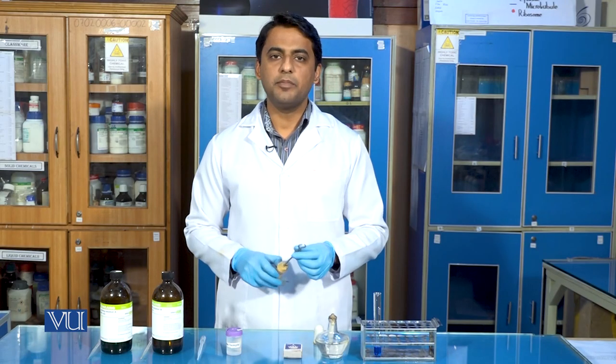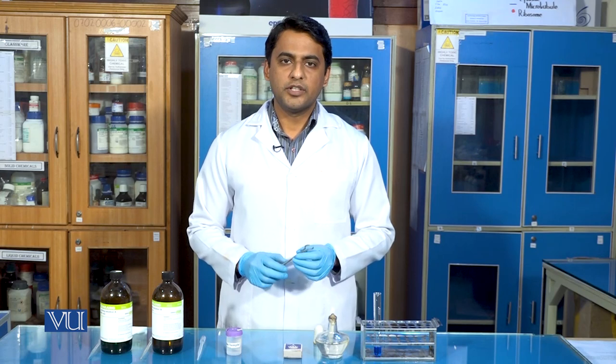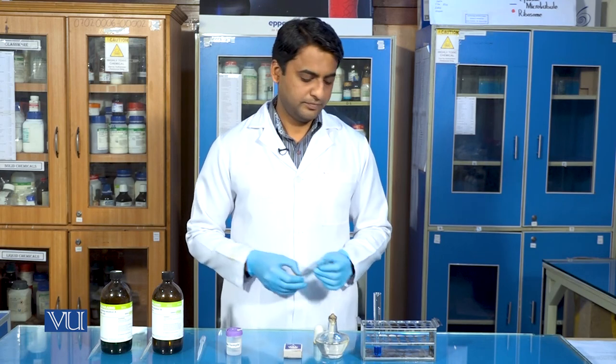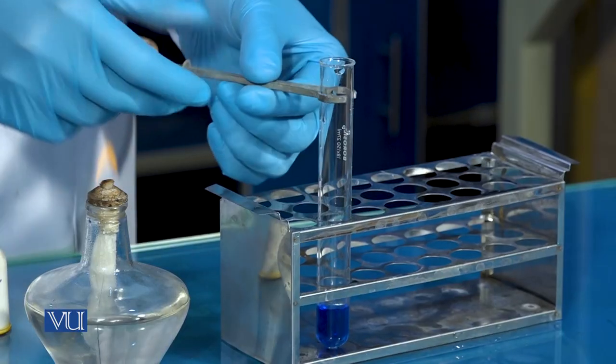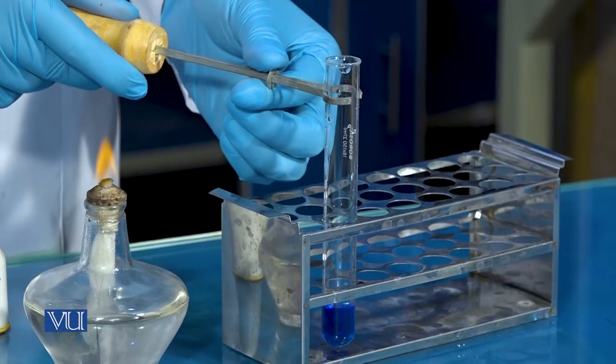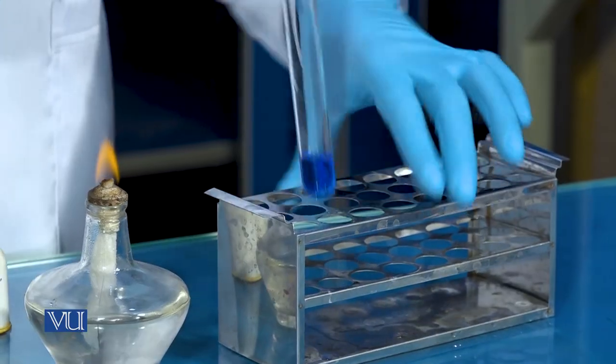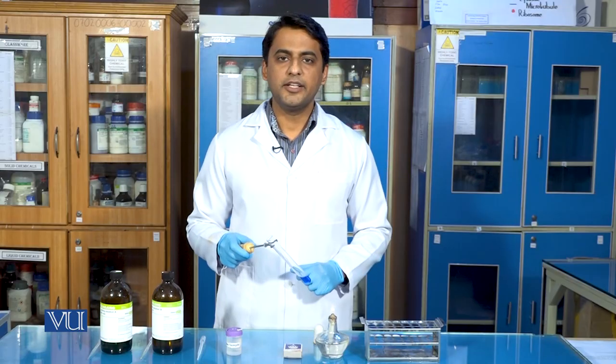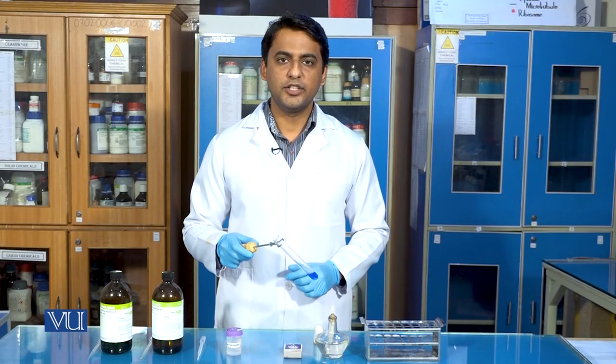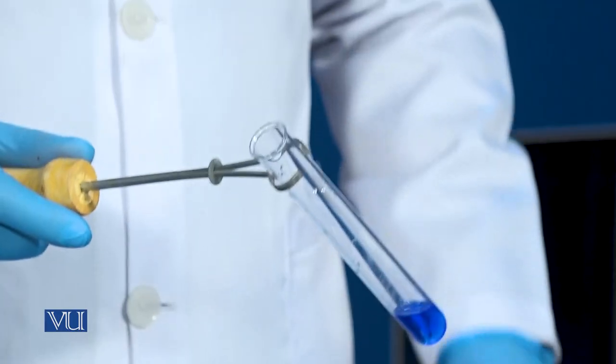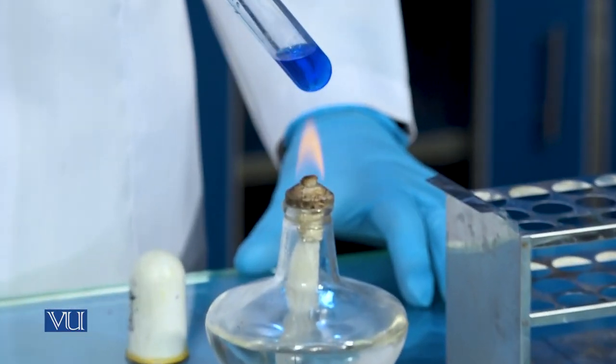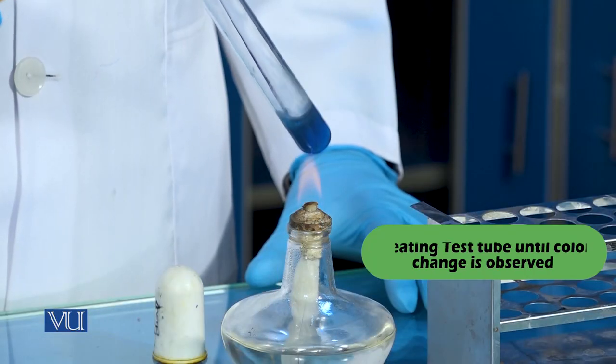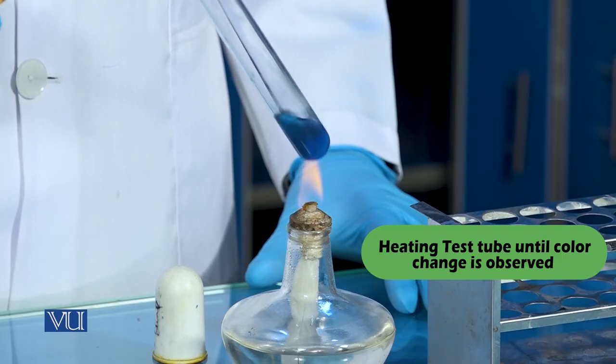Now with the help of test tube holder, we will hold the test tube. Now we will heat up this test tube for few minutes until it changes into brick red color. Keep shaking the test tube slowly.